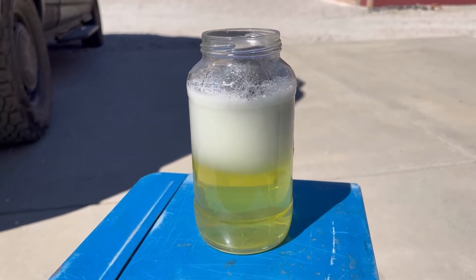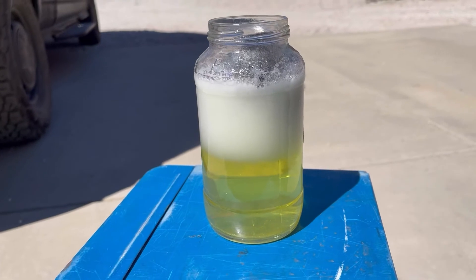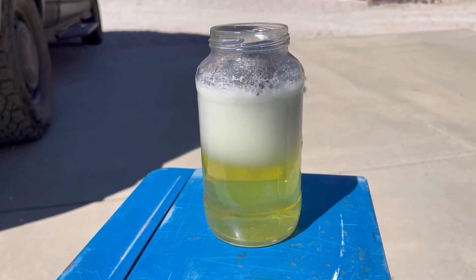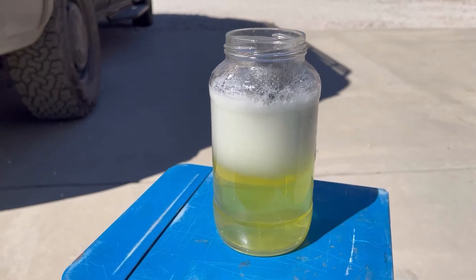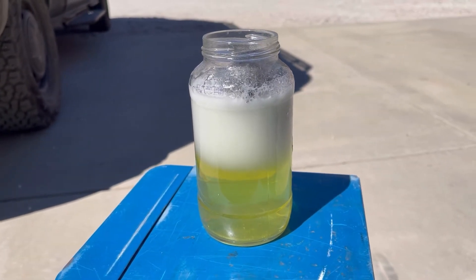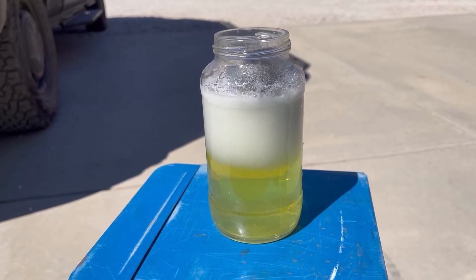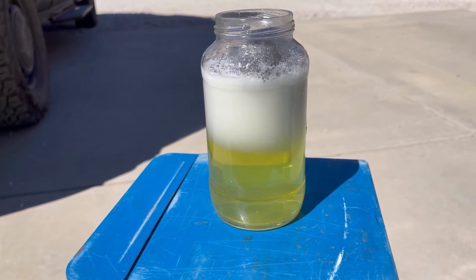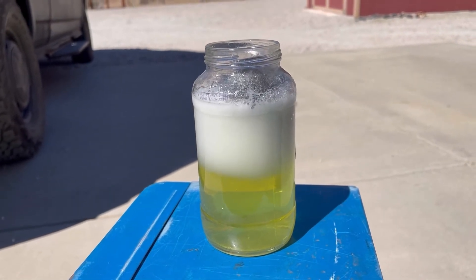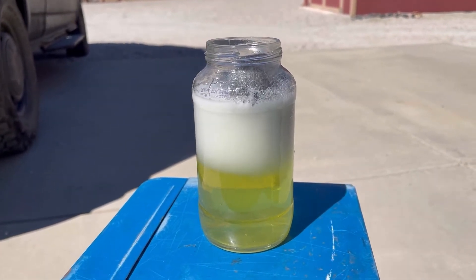You see here, as the acid begins to break down the steel wool, what we will have is ferrous chloride. It's really important to note that at this point it's very important not to have any open flames nearby. As we break down this iron into the acid, it is actually putting off pure hydrogen gas, and this can actually be explosive.